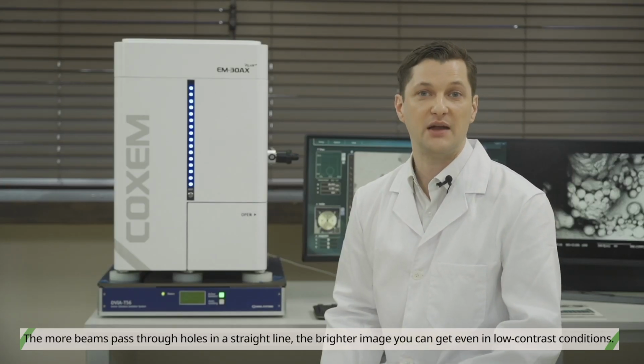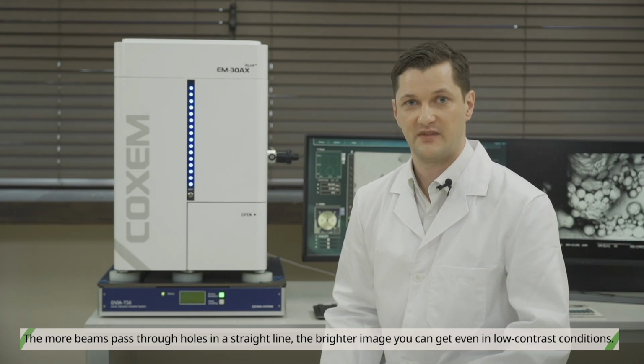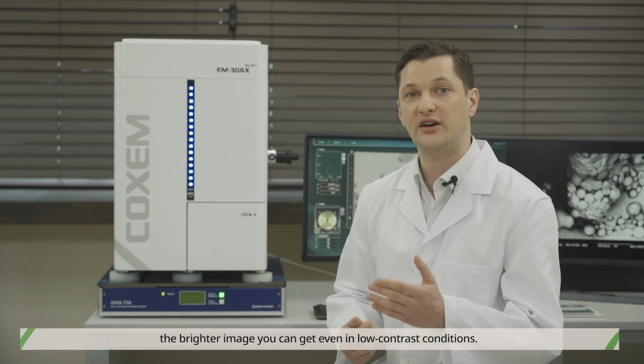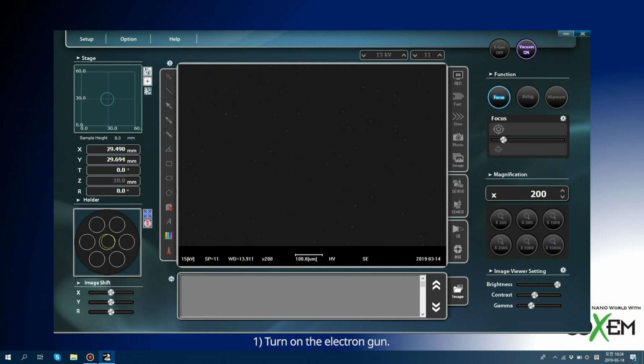Basically, gun alignment refers to the process of finding the brightest spot. The more beams pass through holes in a straight line, the brighter image you can get even in low contrast conditions. 1. Turn on the electron gun.